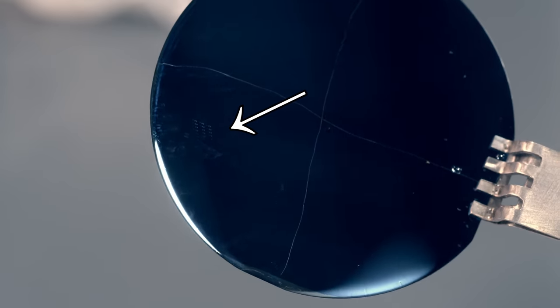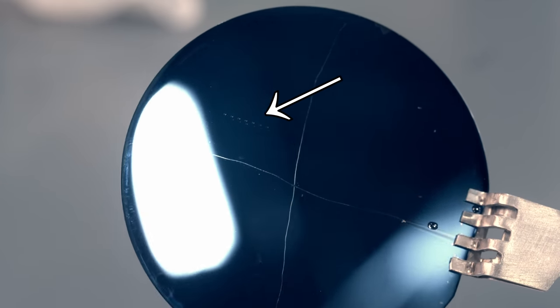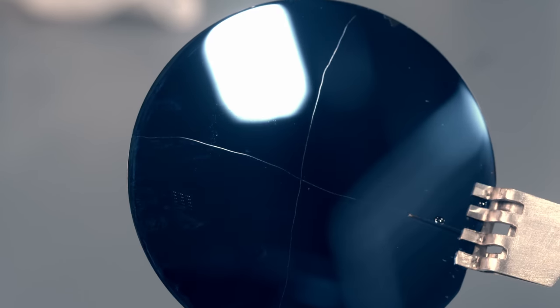So we scan the electron beam in whatever pattern we want, and wherever that beam strikes the acrylic, it chops the long polymer chains into short monomer chains. Those short chains are easily dissolved in IPA and wash away, leaving acrylic everywhere except where the beam struck. We can then use that patterned resist for whatever processes we need — depositing metal, etching, or whatever.